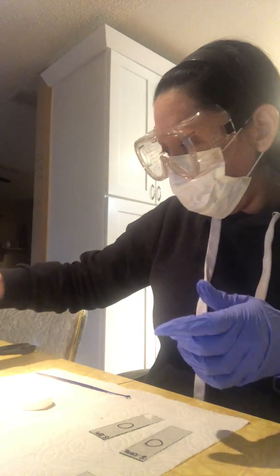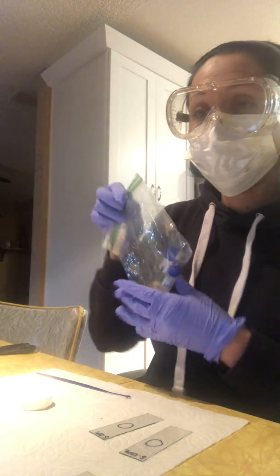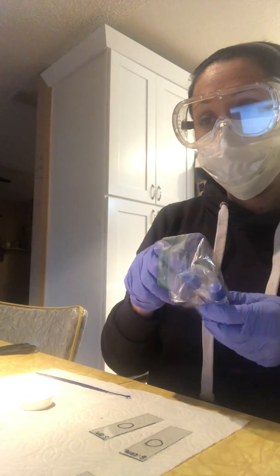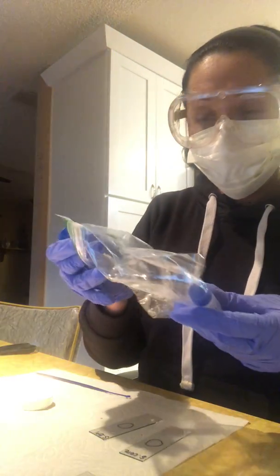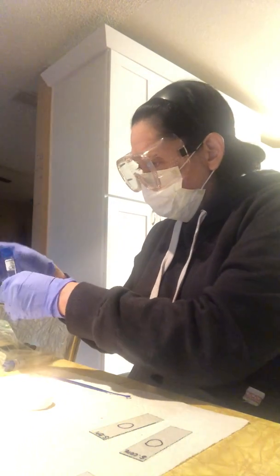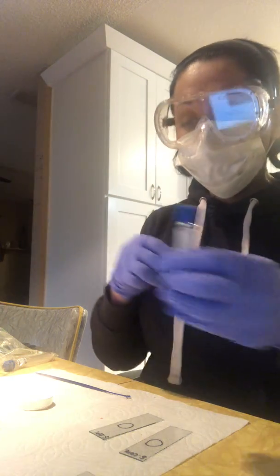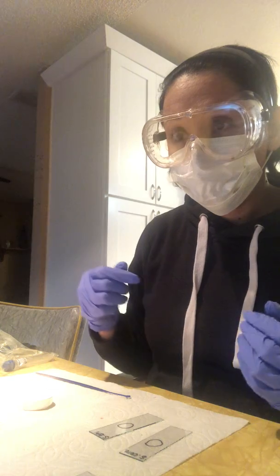I'm going to go ahead and do the same procedure for the other two samples, the Cerevisiae and the epidermidis.